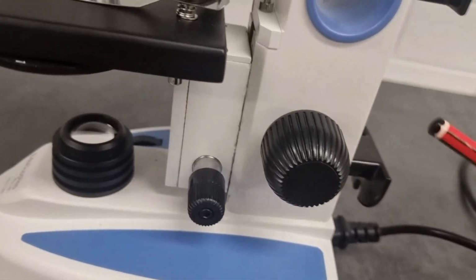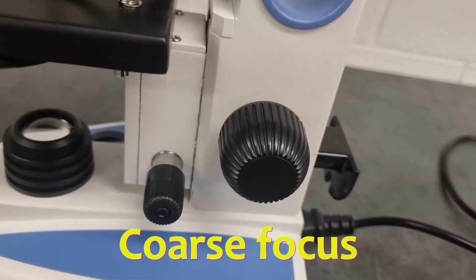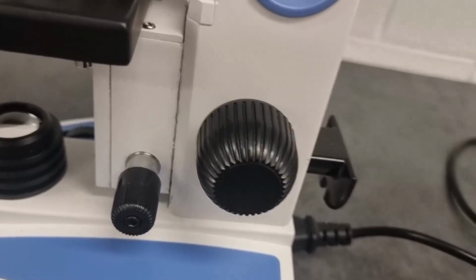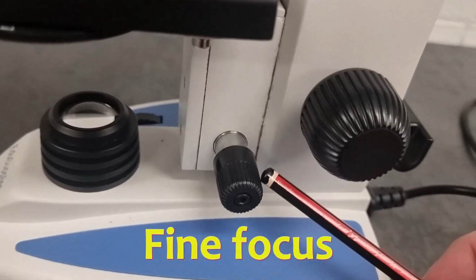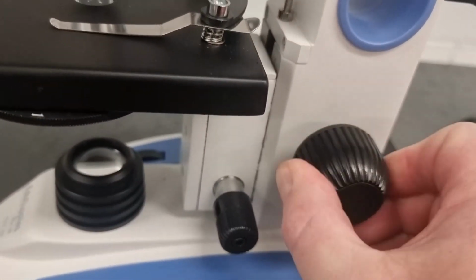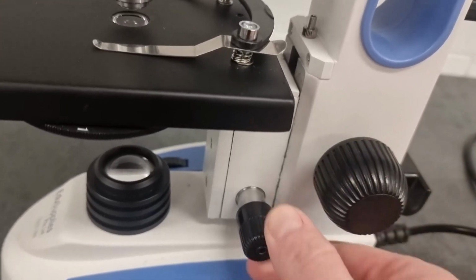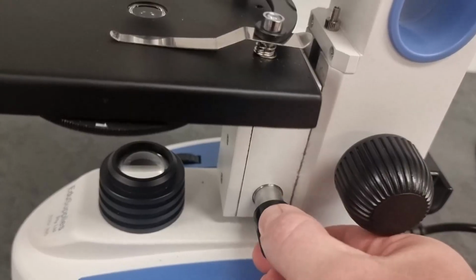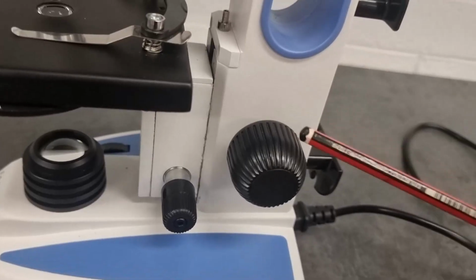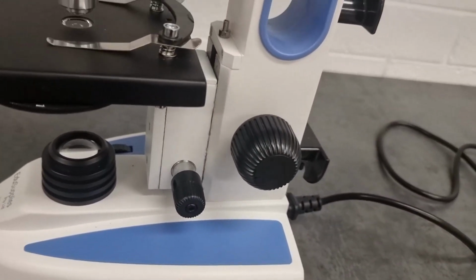What you'll find is that the larger knob is called the coarse focus. That's the one that you would start with to get you in the ballpark of, yeah, it's pretty focused, it's trying to be sharp focus, and then you move to the smaller knob, which is the fine focus. So these are just a simple matter of turning these up or down. Now you'll note the stage is moving up or down. So you turn the knob, and when you turn the small one, the stage doesn't move very much at all, because that's your fine focus. Okay, so first you use the coarse focus, and then the fine focus to get your image nice and sharp.